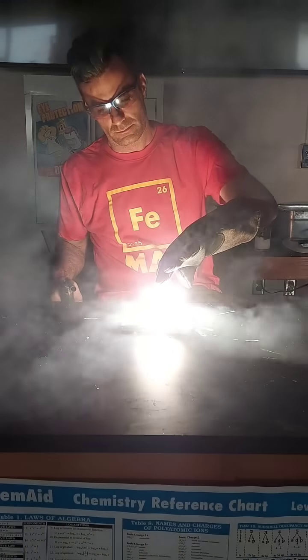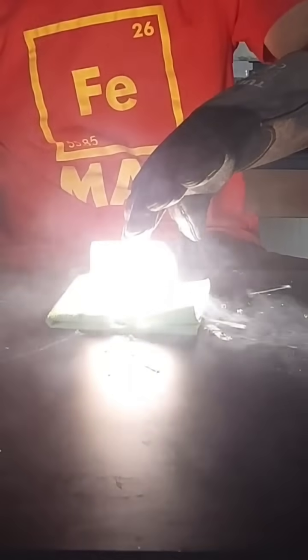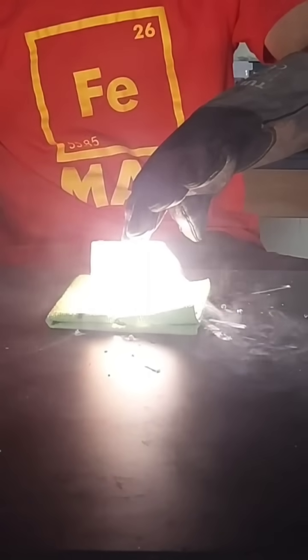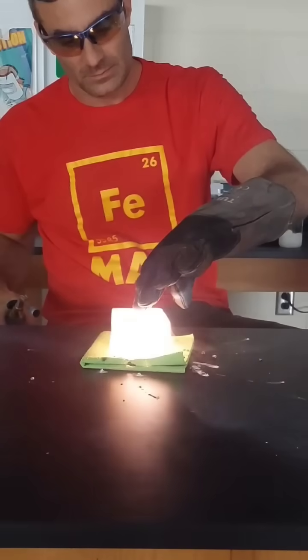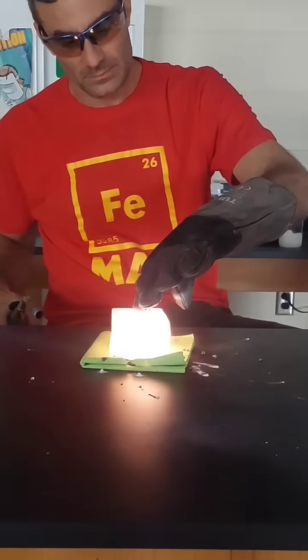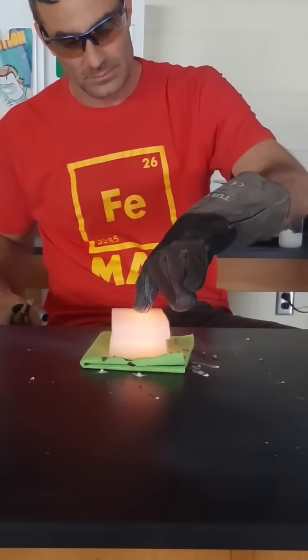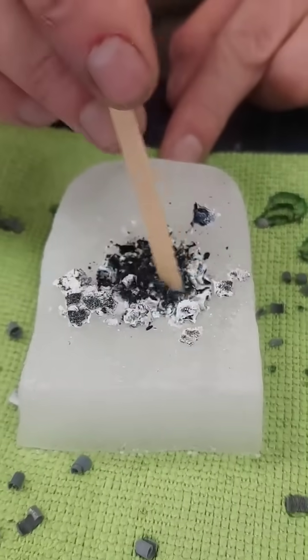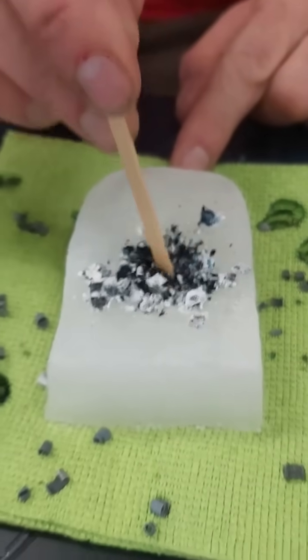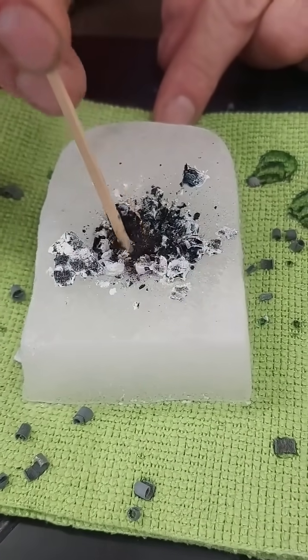So as you can see, the reaction gets quite a bit more intense once the dry ice block goes up on top. That's because magnesium burns so hot it's able to cleave the CO2 molecule in three, freeing up some oxygen for combustion, and the carbon gets left behind with some magnesium oxide, as we can see there.